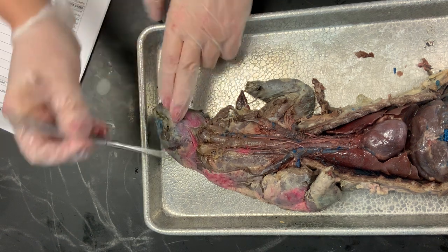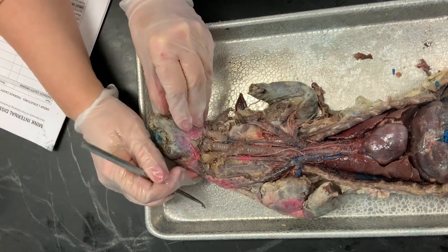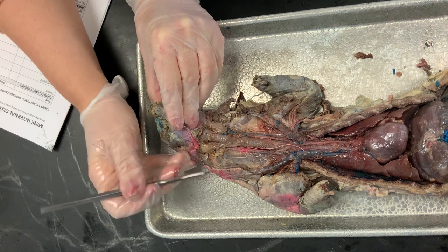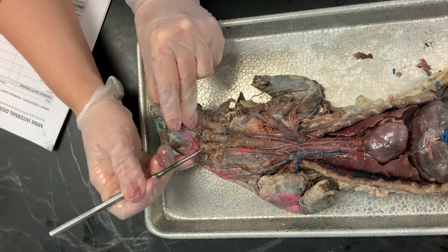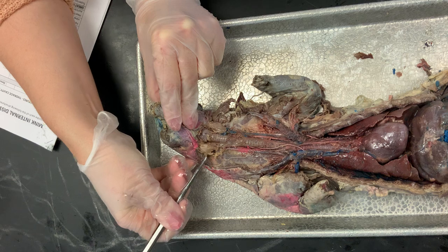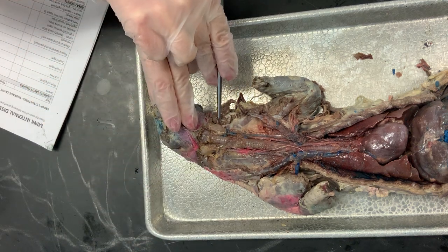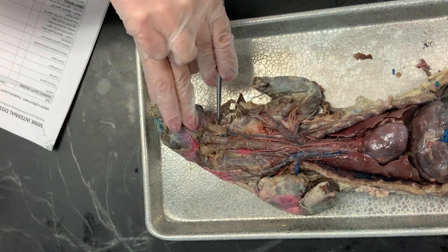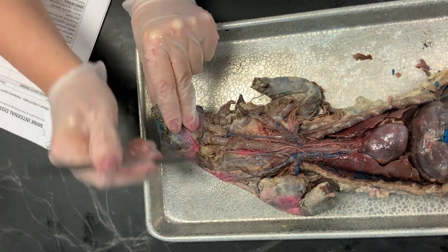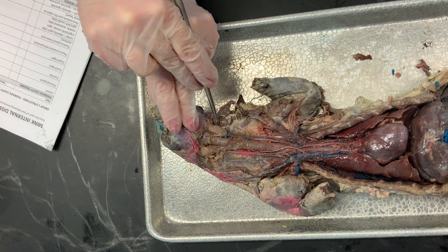Just at the bottom of the larynx and the upper region of the trachea, you're going to see the lobes of the thyroid gland. There are two lobes — here would be the right lobe, and over here would be the left lobe. These constitute the thyroid gland. This is the right lobe of the thyroid gland and this is the left lobe of the thyroid gland.